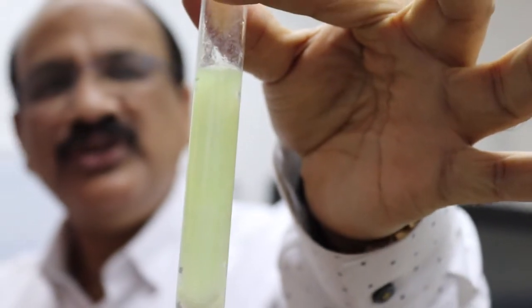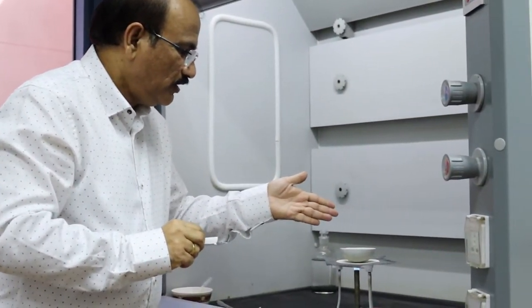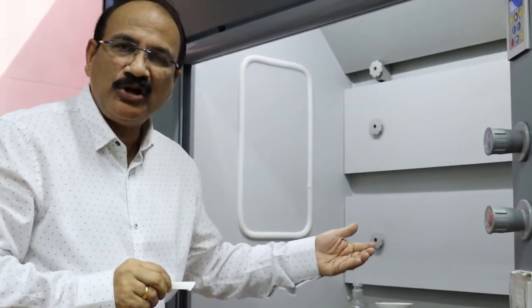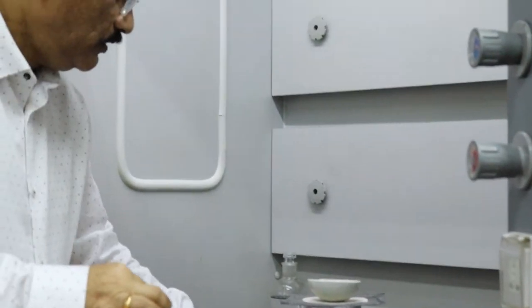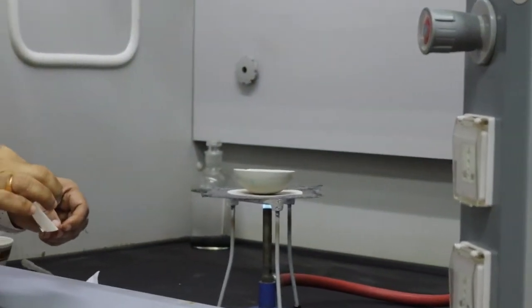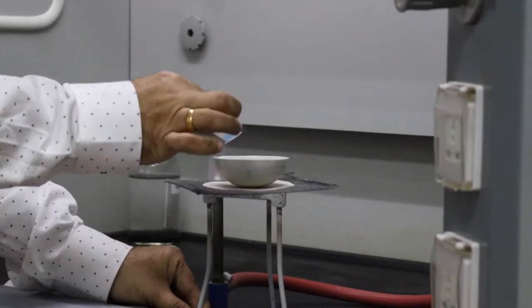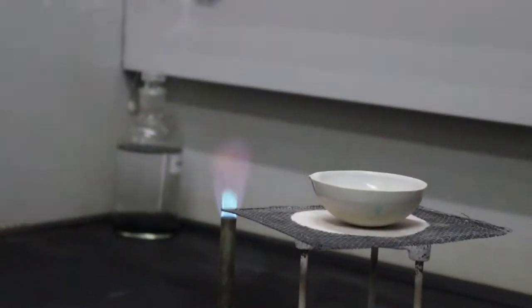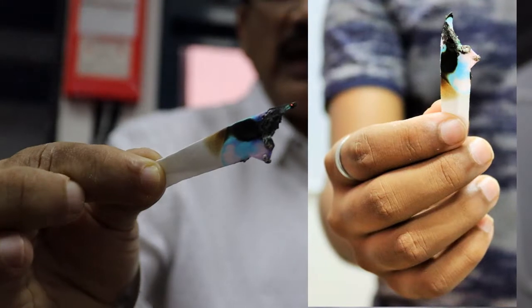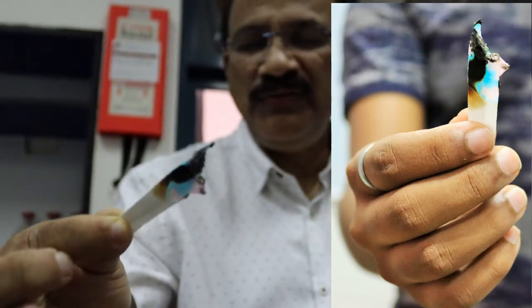We are doing yet another confirmatory test for Zn2+. We take a crucible containing the salt, add concentrated nitric acid and cobalt nitrate. We dip a strip of filter paper into the boiling solution and then burn it. The ash produced is green. In the case of aluminium we get blue ash, but for zinc we get green ash.